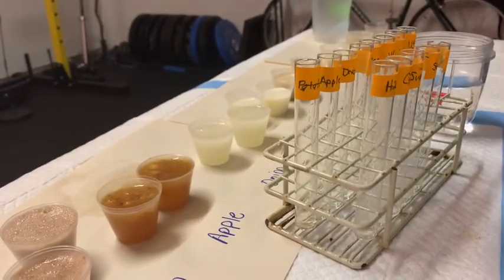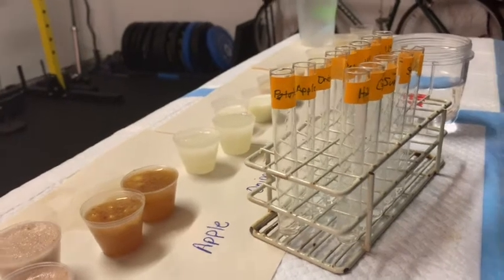So what we have now is we've established the beginning of our assay. We've got all of our test tubes, and each test tube has one mil of water in it. The next thing we're going to do is add each of our juices.